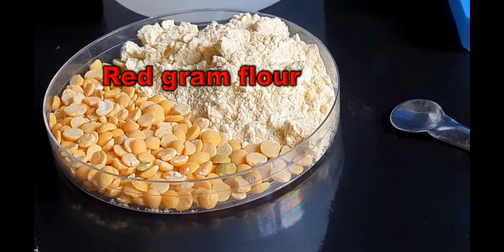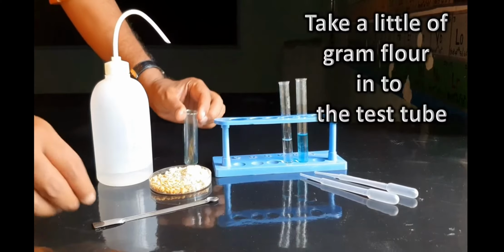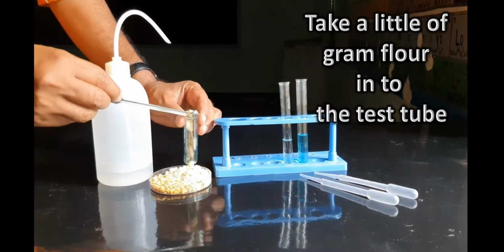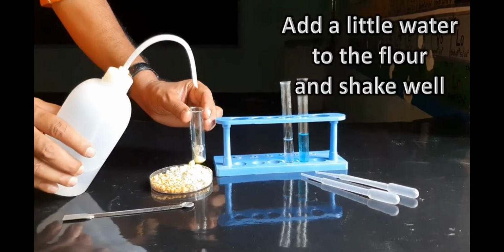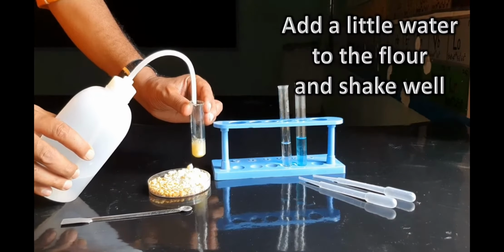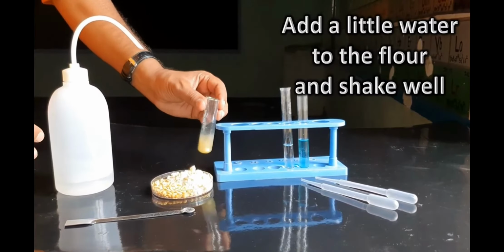We will take red gram flour as a food item and take a little amount of gram flour into the test tube, add a little water to the flour and then shake it well.